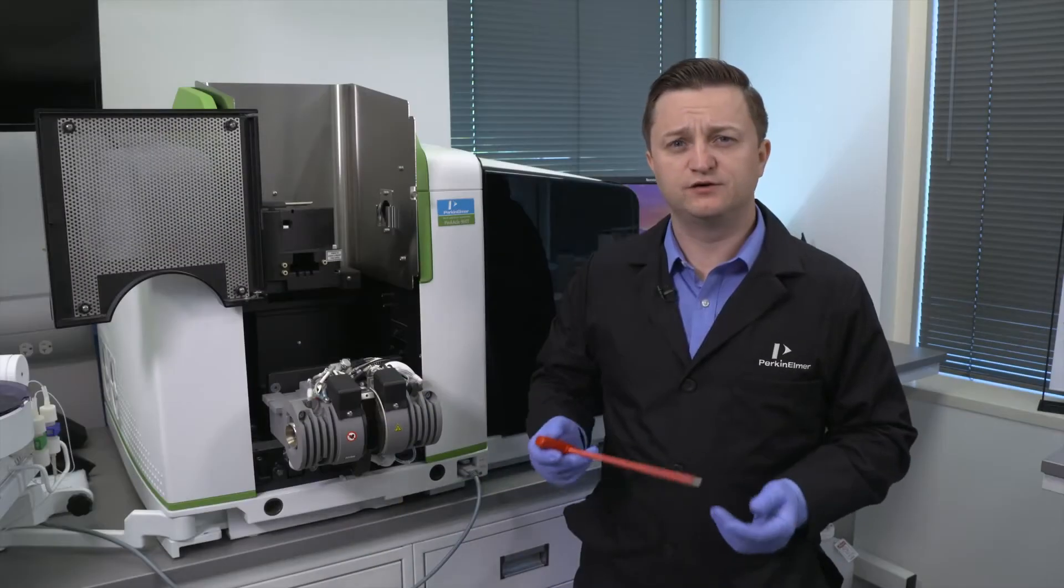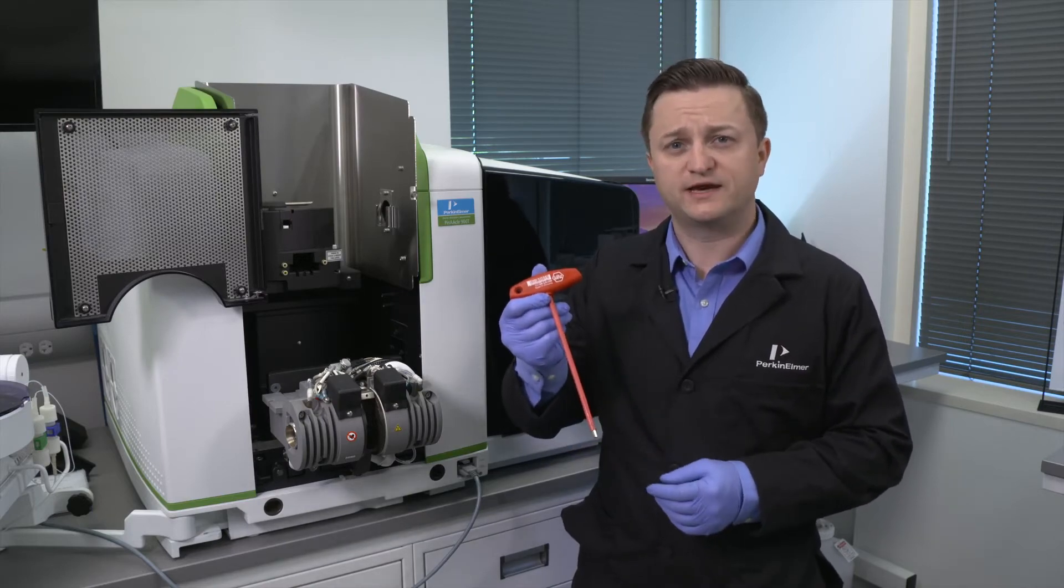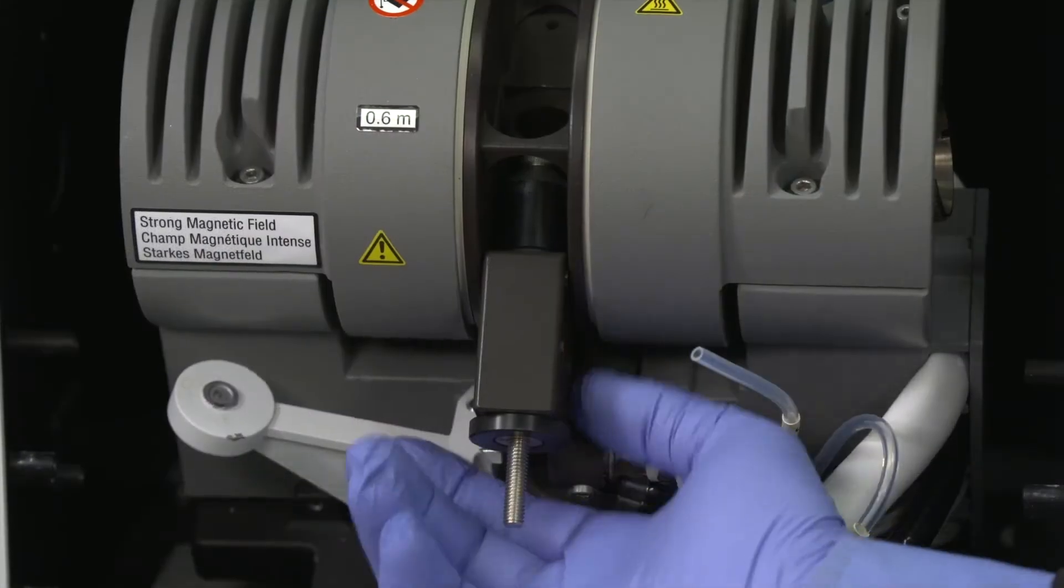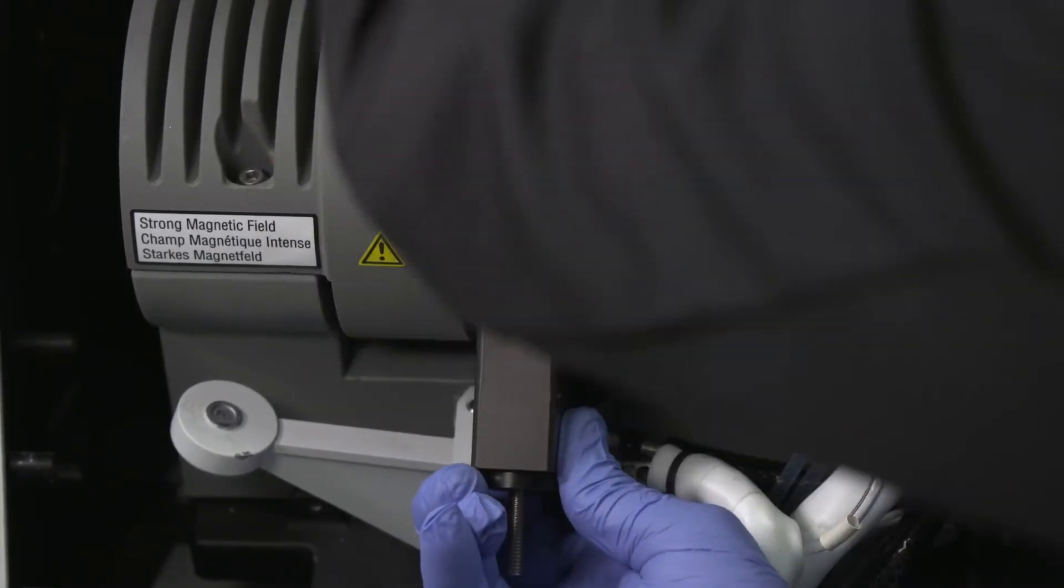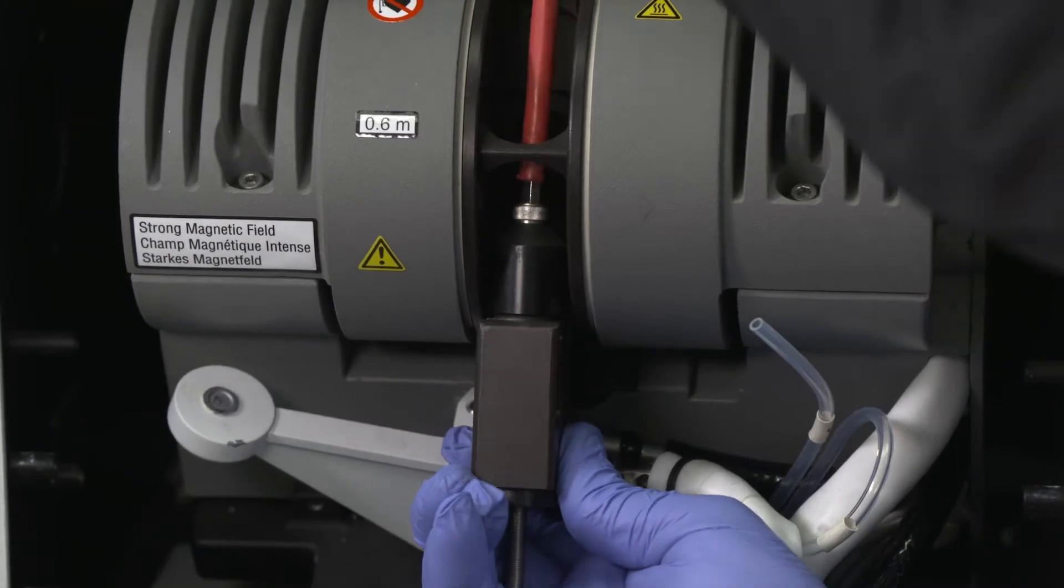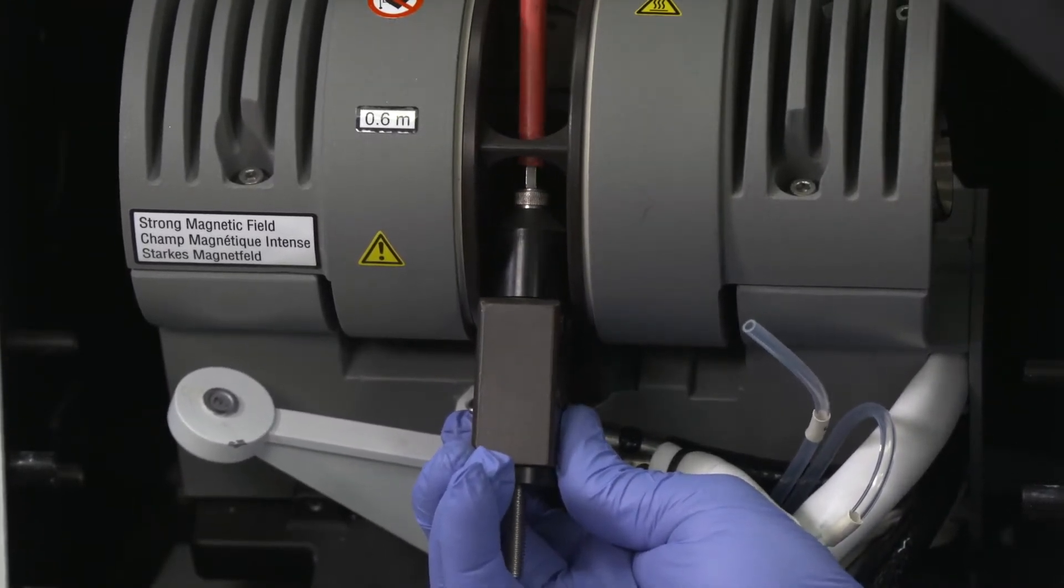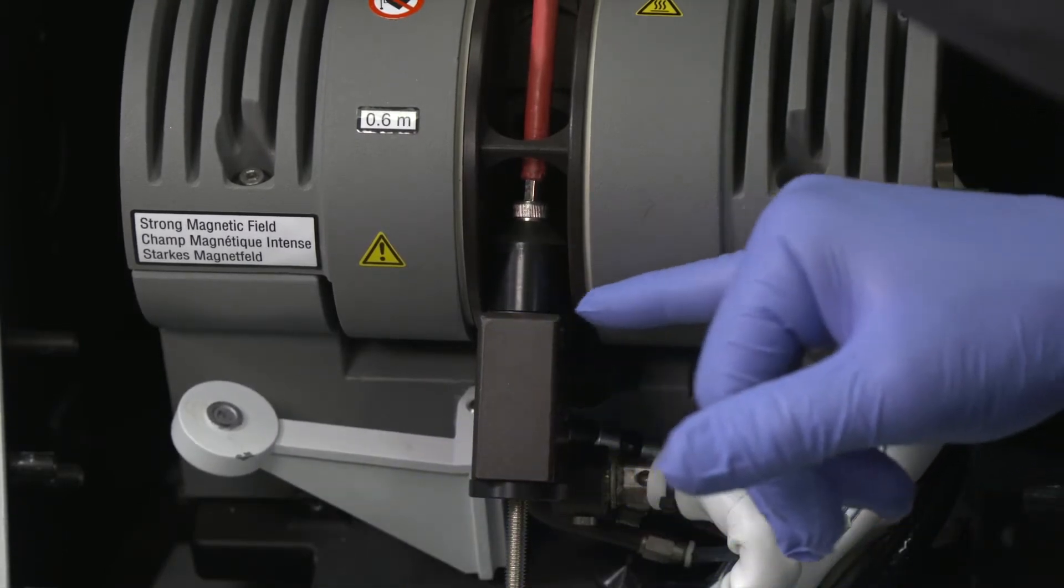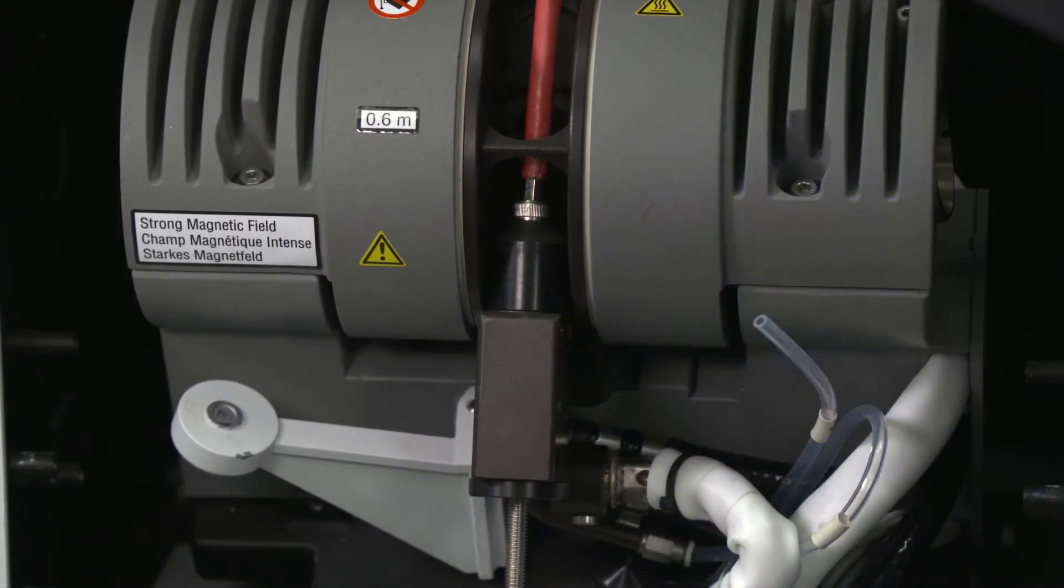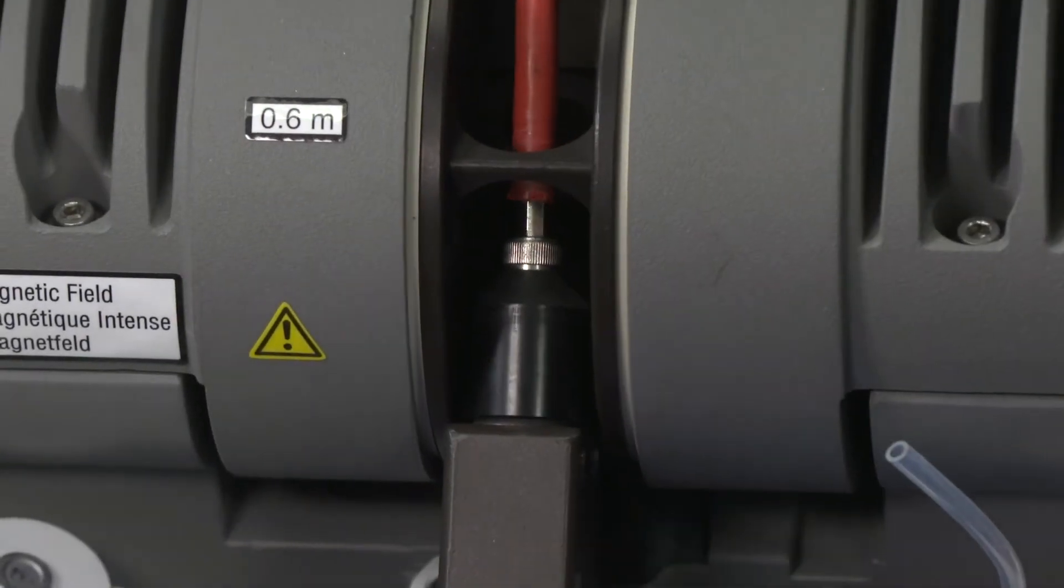Now to push in the front contact cylinder, I recommend the use of a long hex driver. Tilt the furnace back into its original position. Use the hex driver to screw the bolt into the threaded cylinder and push the contact into the contact housing. Now screw in the bolt until the rim of the contact is flush with the contact housing. Do not use excessive force to push the contact into the housing as this may shatter the contact.